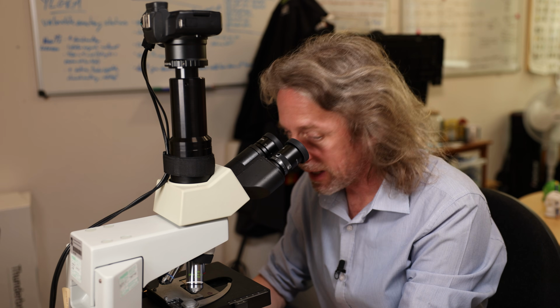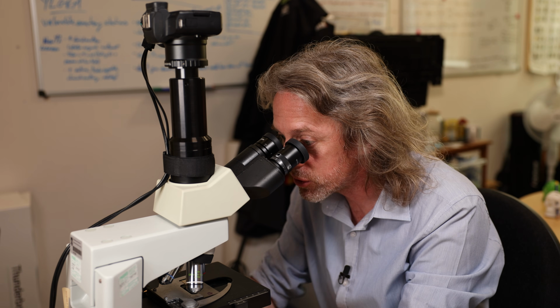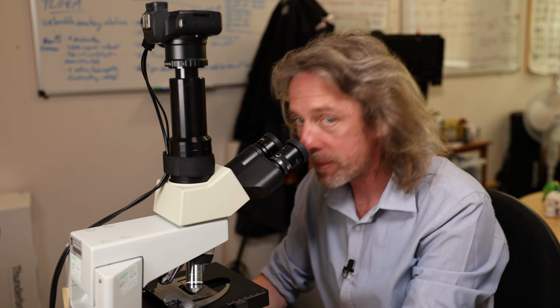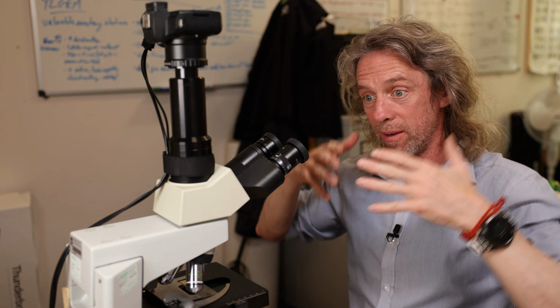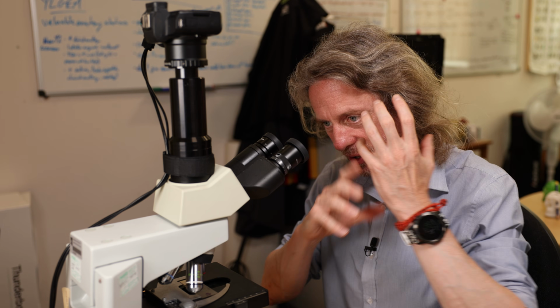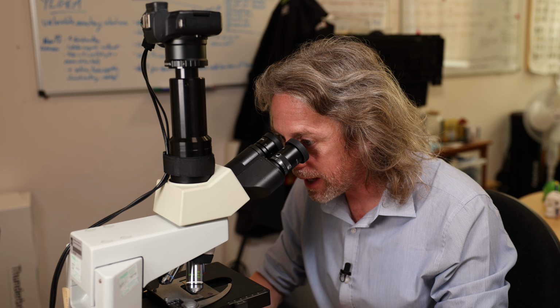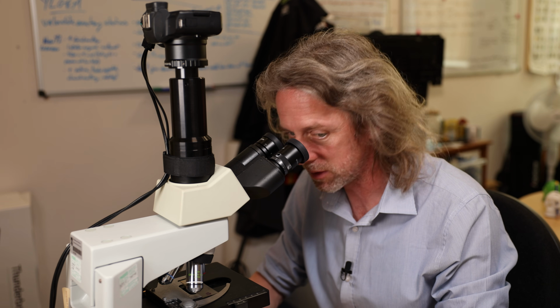So the aim there, again, as with all of these histology videos, is to be very visual and slow. I'm sure it's way too slow for many people. But by doing that, we've seen how the layout of cells and tissues continues with that branching pattern of the bronchioles. It's not super complex. Once you get the pattern, you see that it continues and continues and continues. And the alveoli are probably by necessity quite simple. Anyway, I think it's beautiful stuff.